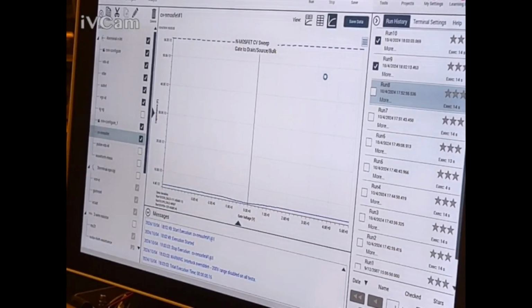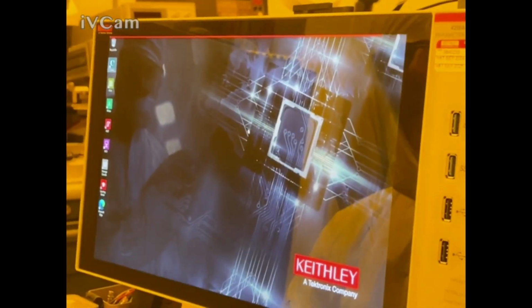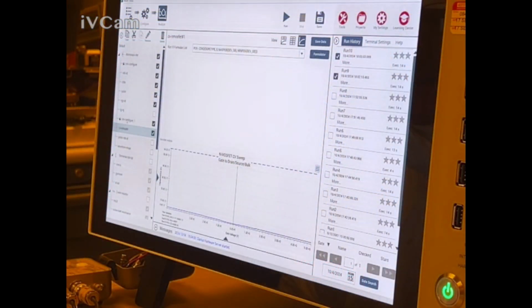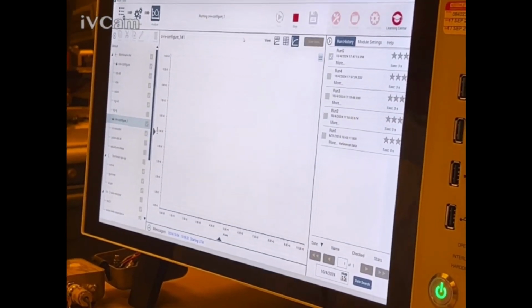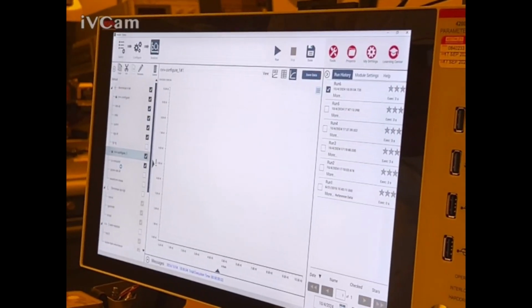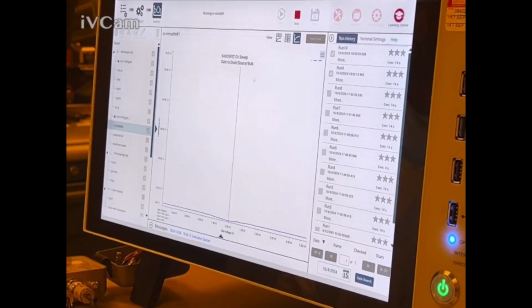Okay, here's what we're gonna do. We're gonna start over. That's just not right. You're gonna wait a couple seconds before you run it again. Okay, let's go to CV config. Let's run that to get that set up. Boom, boom, boom. CV MOSFET. Let's run that. See what happens there.